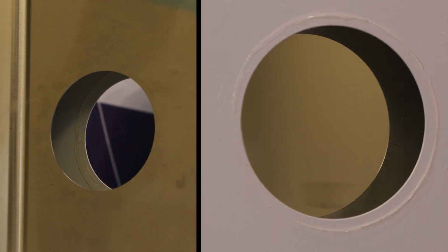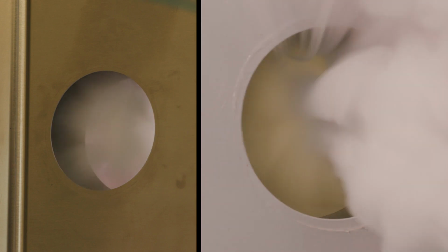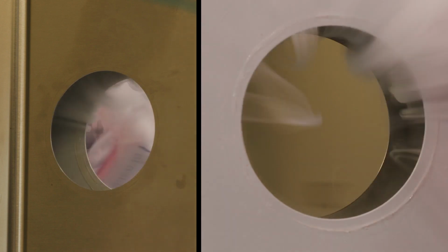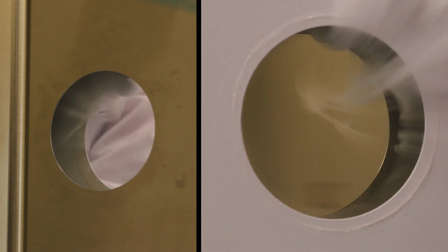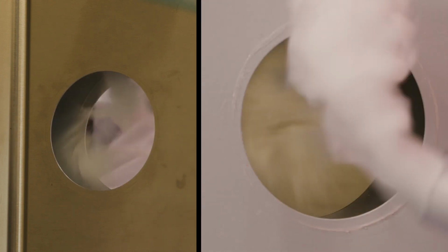Hand me the smoke. Okay, and as you can see, the smoke that's being generated from the outside of the cabinet is not coming in to the inside of the cabinet here. The smoke is going up through the double layer wall here. It's creating a negative pressure and the smoke is being pushed up into the plenum. So the great thing about this is that for the SmartPorts, you don't have to worry about getting contamination from the outside of the cabinet in or inside of the cabinet out. So it just provides that other level of containment.